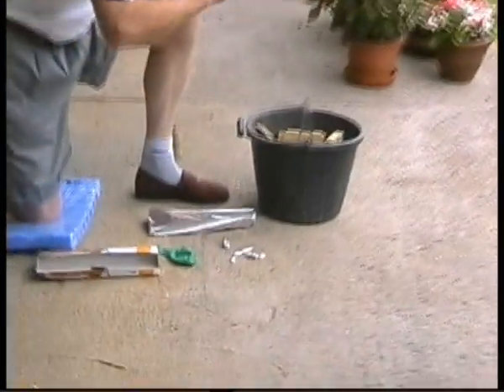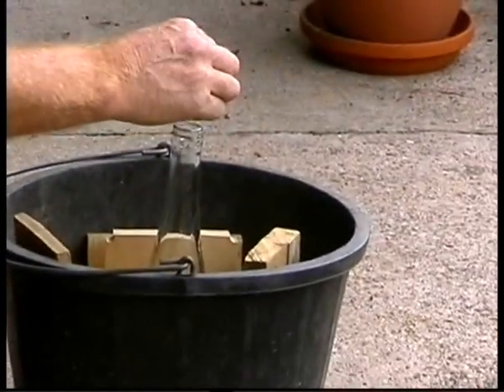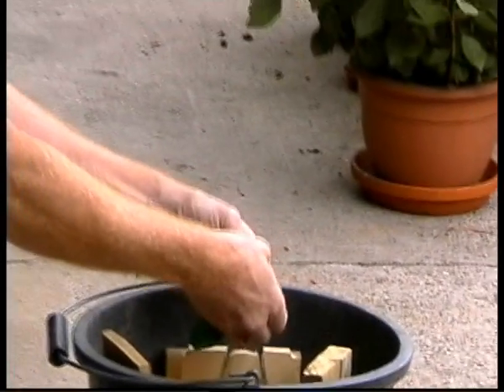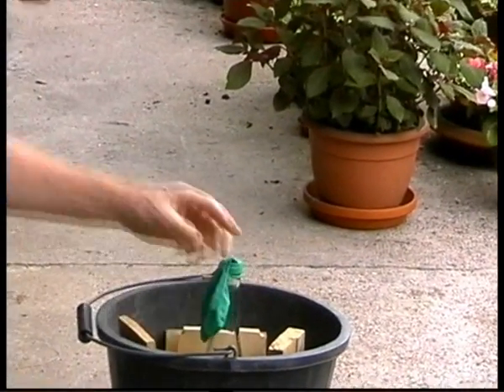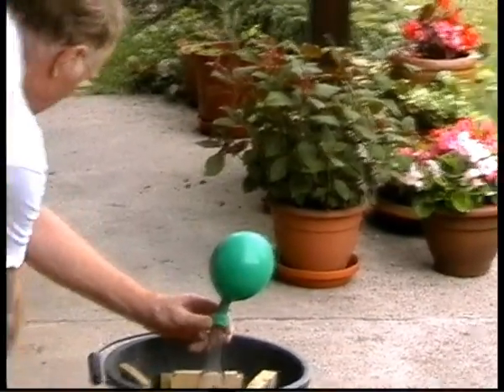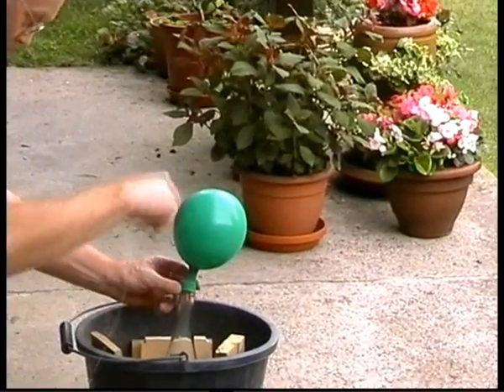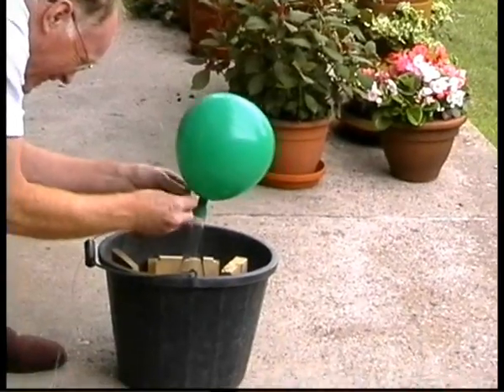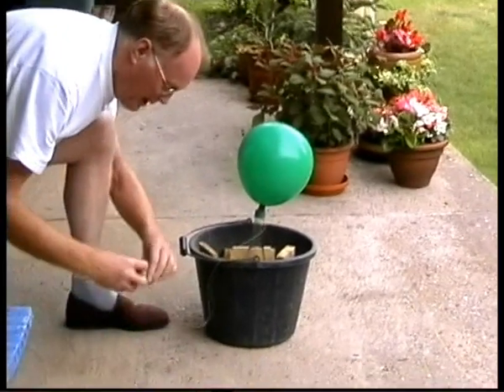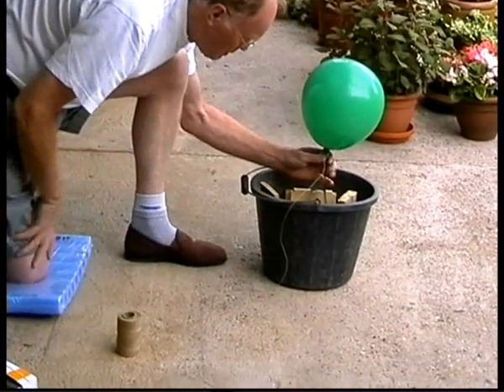When we put the pellet into the sodium hydroxide solution it will react to make hydrogen. And put it out of the neck of the bottle like that. And when it gets to the right side I'm going to tie the neck. When the time comes I can just pull that. Oh, it's warm.